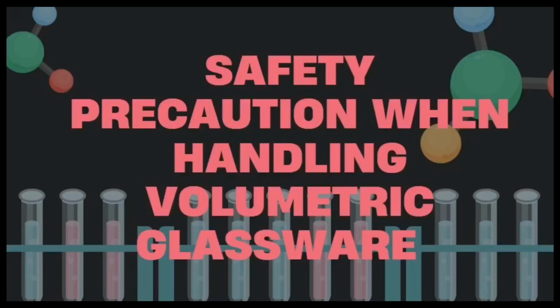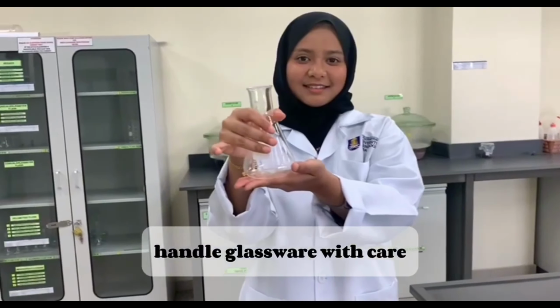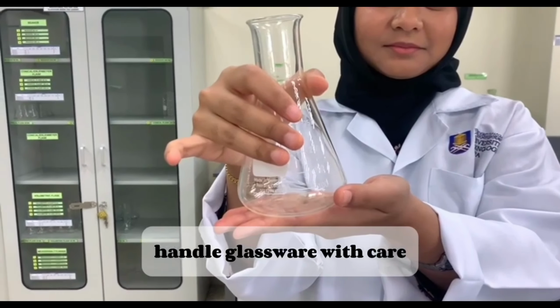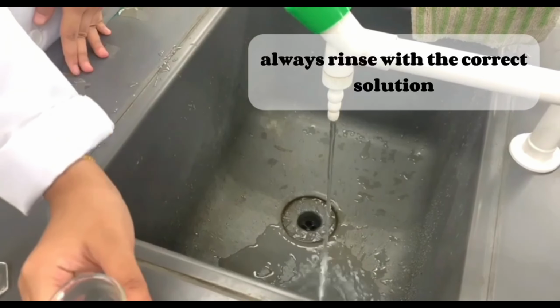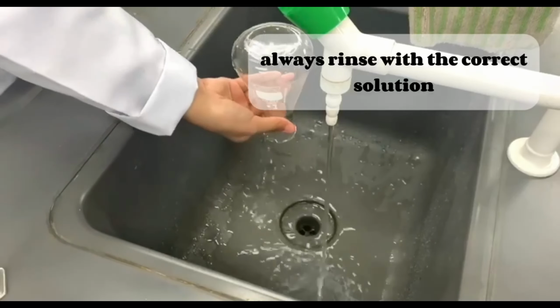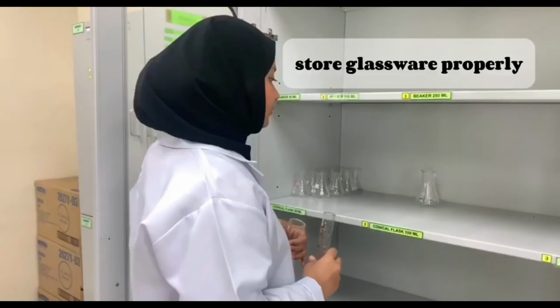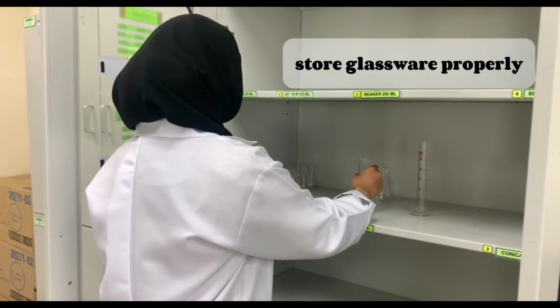Next, we move to the safety precautions when handling volumetric glassware. Please always handle the glassware with care. Always rinse with the correct solution to prevent contamination and maintain the accuracy. Lastly, place glassware on a flat and stable surface.